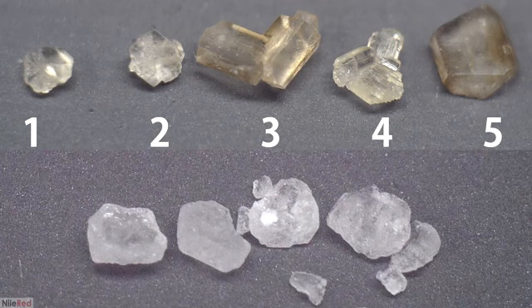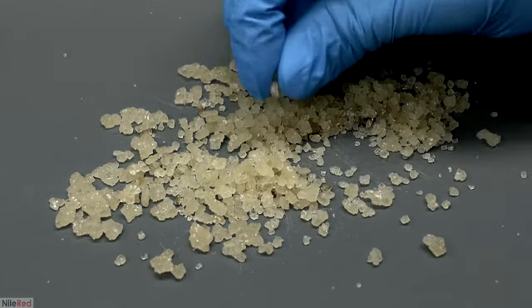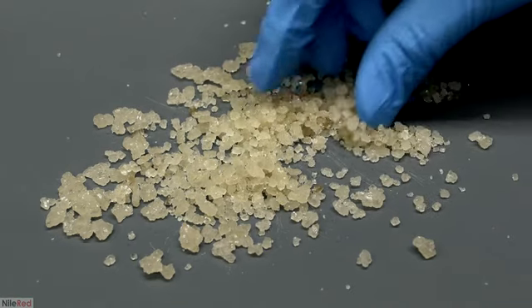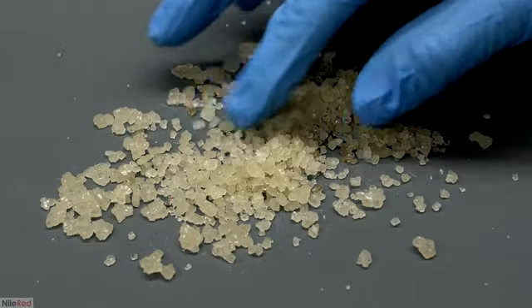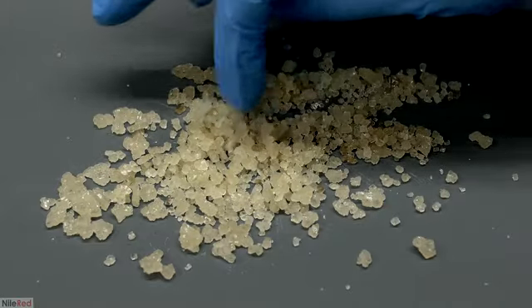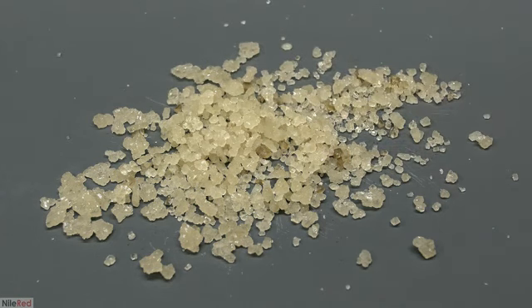Most of the crystals look citric acid-like, and I think crystals 3 and 5 are actually impurities. They look extremely different from the typical citric acid crystal, and on top of that, they're significantly discolored. Anyway, going back to the overall shot of the crystals, you can see they're all pretty yellow. To clean them up, I can crystallize them in water like I did before. However, this process is really slow, and I didn't really think it was worth it, considering I can just buy citric acid from the pharmacy.